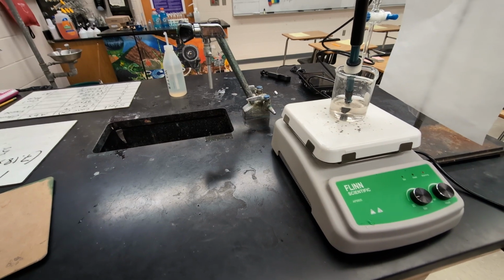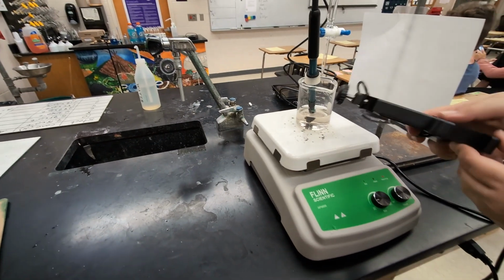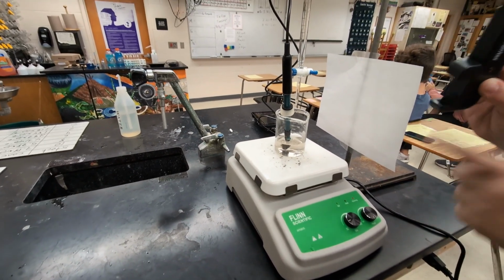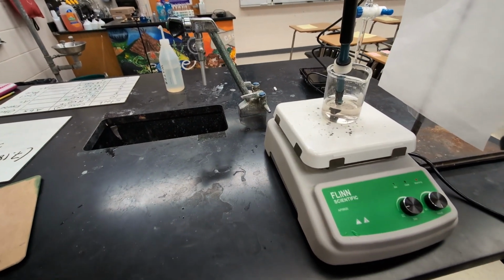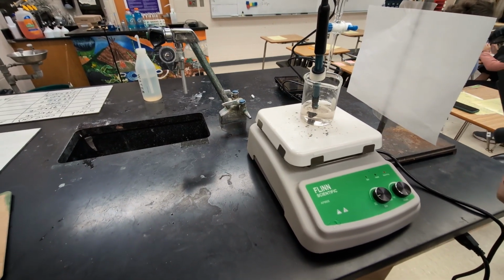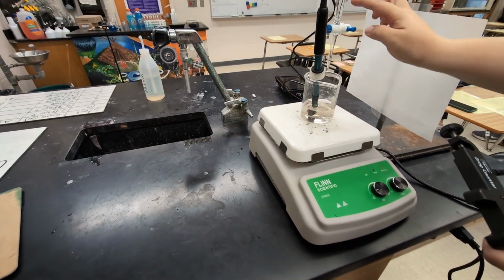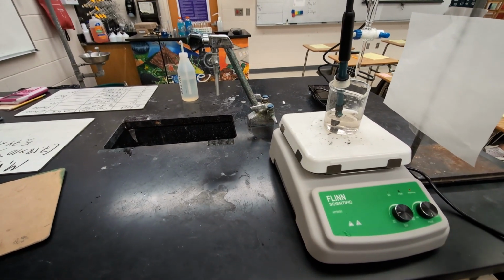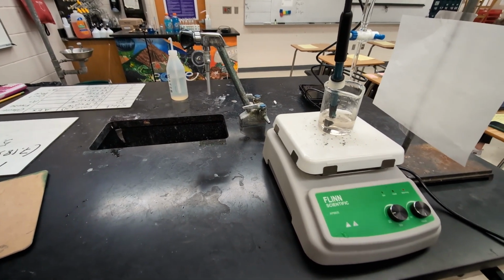Now, you can use an attachment like a drop counter. I have some of those. They look like this. You have to calibrate it to the correct size of the drop, and then it will essentially run the titration for you. I prefer to have students do it by hand, so that way they're connecting the volume of the solution and the pH to the pH curve, and it makes more sense to them conceptually that way. So what we're going to do is add about a half of a milliliter at a time, stop, record the pH and the volume at that point, and then add another half of a milliliter, do the same thing until they get a full titration curve.